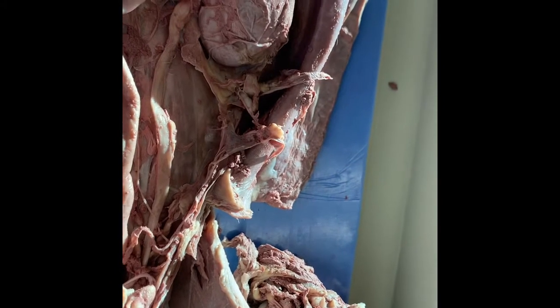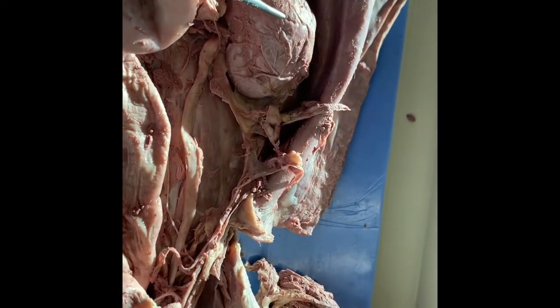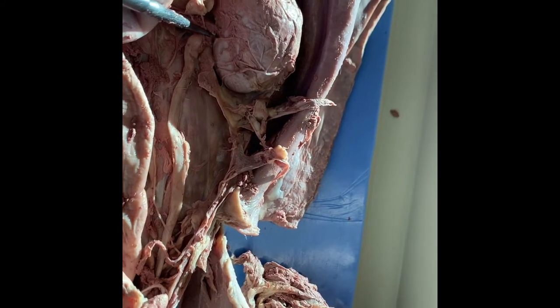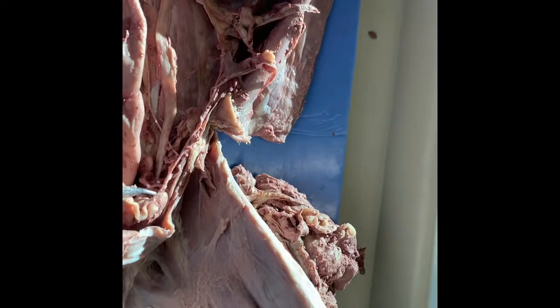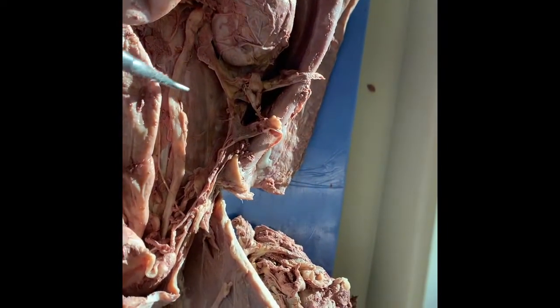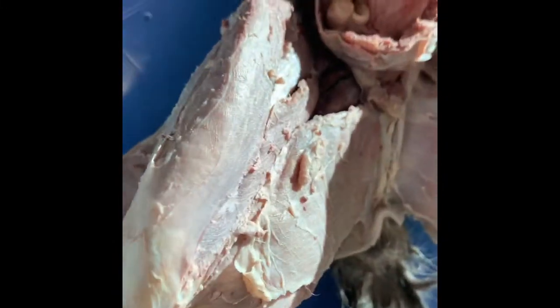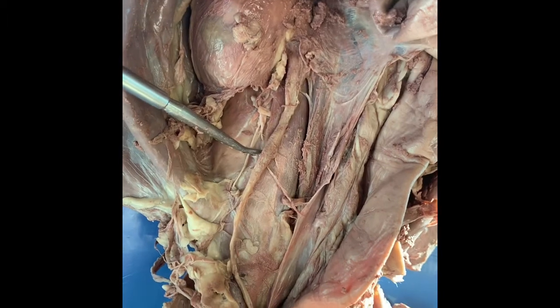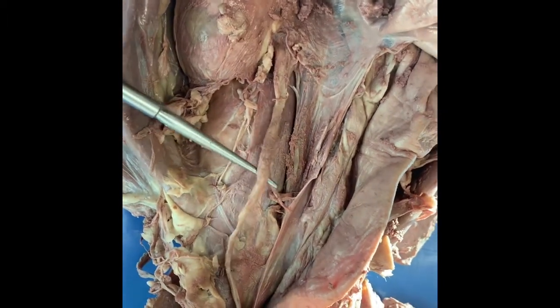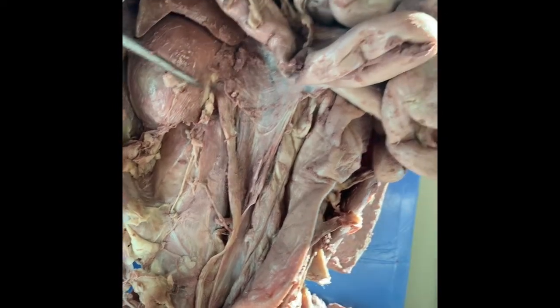So the kidneys filter out the body's fluids, they separate all the important nutrients and the salts, and then that filtrate travels down this ureter and then collects in the bladder. So this is the left kidney, the left ureter, and then on this side, we have the right kidney and the right ureter. One of them was kind of hidden on me, okay? So we'll be taking these out shortly.